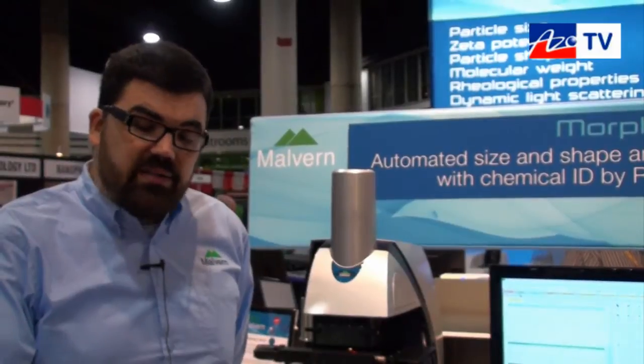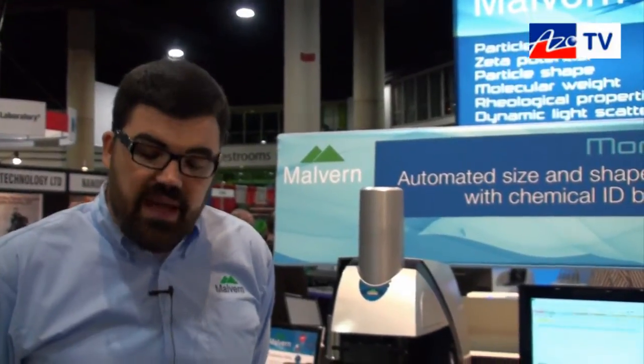Is there application in detection of counterfeit pharmaceuticals? It certainly could be useful in that area, as far as being able to identify whether or not the product is made up of the innovator's original formulation. You can certainly tell that there are different things there that aren't expected to be there, and what proportions they're in. So yes.